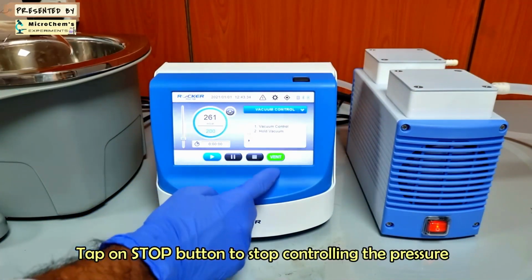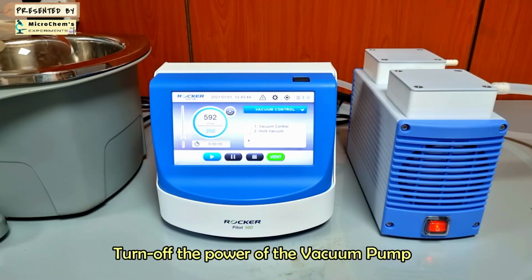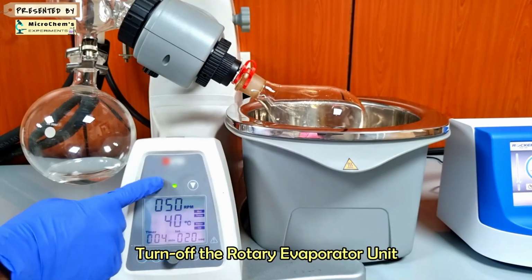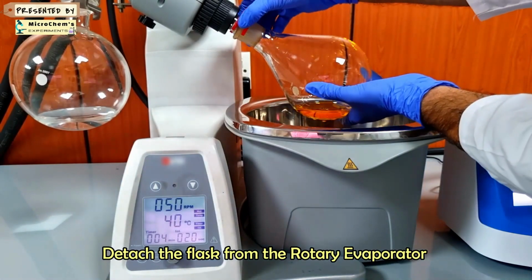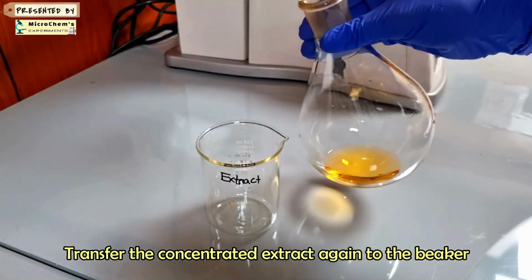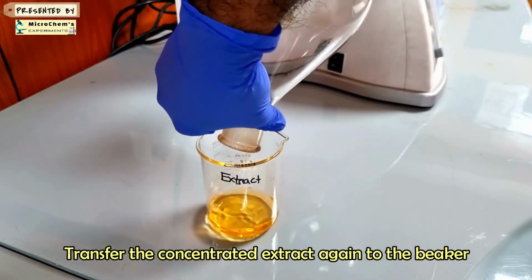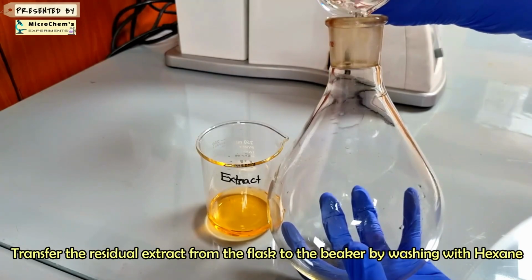Tap on the stop button to stop controlling the pressure and long tap on the vent button to release the pressure. Turn off the power of the vacuum pump. Turn off the rotary evaporator unit. Detach the flask from the rotary evaporator. Transfer the concentrated extract again to the beaker. Transfer quantitatively, washing with hexane.